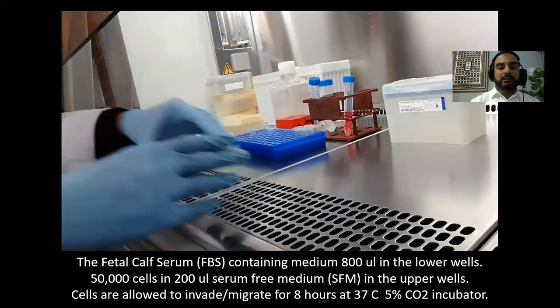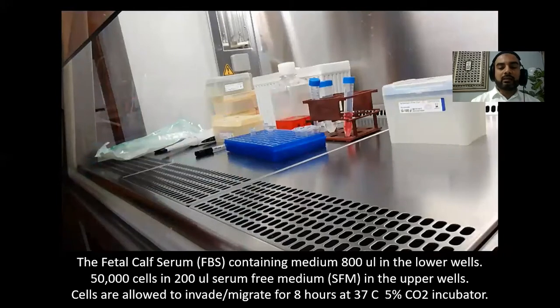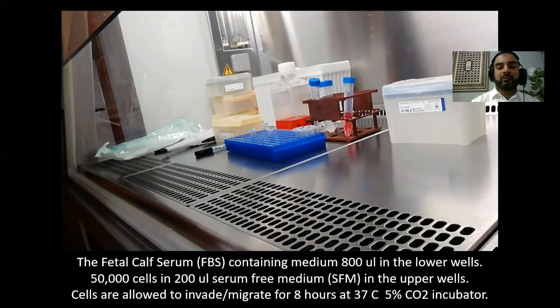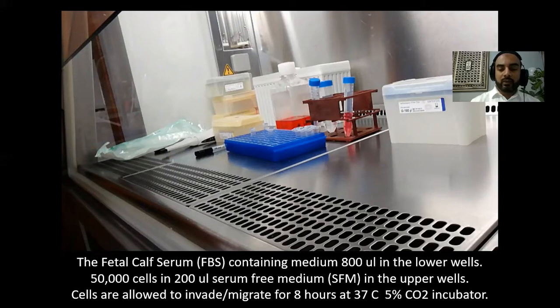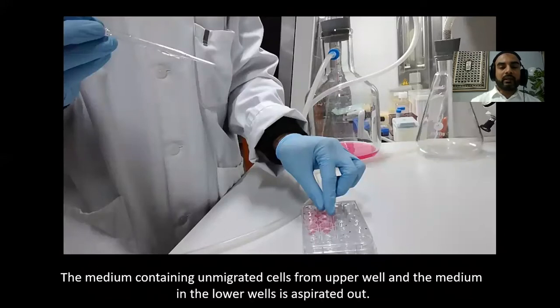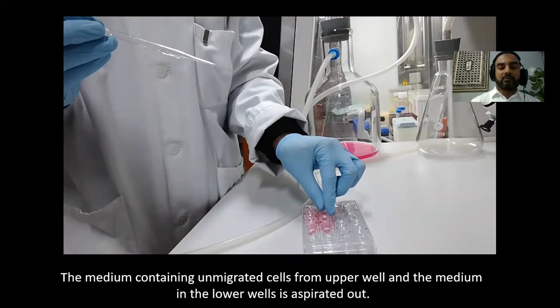We are now ready to put the plate in the incubator at 37 degrees Centigrade, supplemented with 5% carbon dioxide. We allow the cells to migrate for eight hours. After the eight hours are complete, we proceed to the next steps.